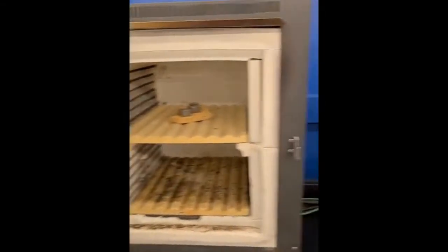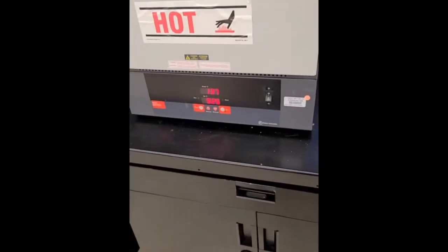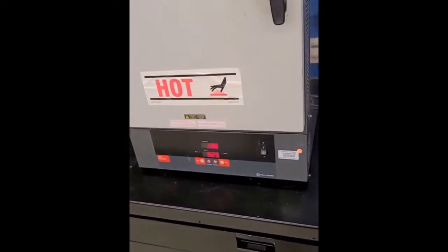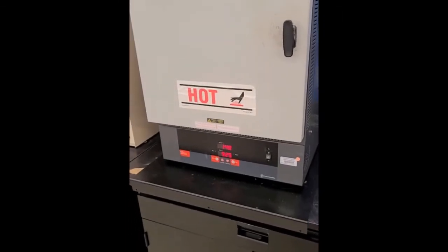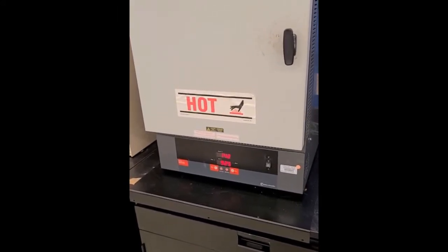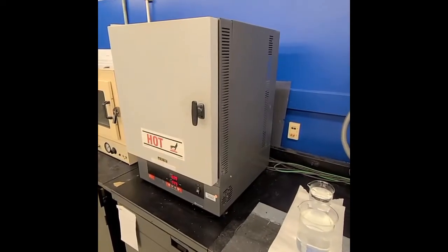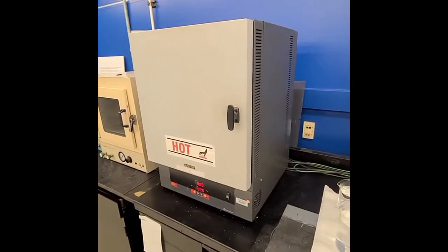All right, so we can set this up, close it. We'll let this ramp back up. Once we get up to our desired temperature, I'll pop it open and show you how it looks. And then we'll wait until these samples create that FCC structure, and then we'll do our different quenching and heat treatment procedures. All right, so our furnace is almost at its point for the austenization treatment.